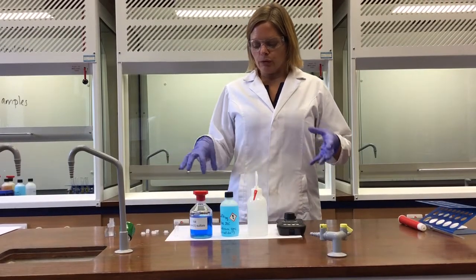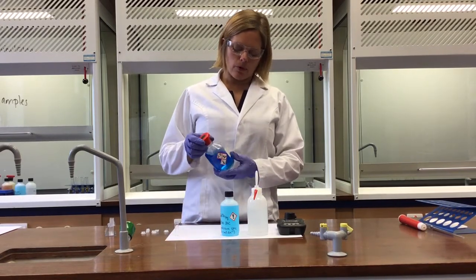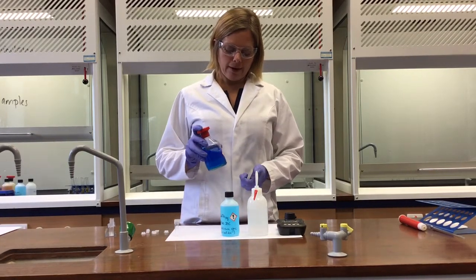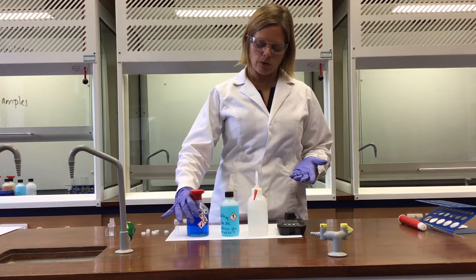We've been exploring the idea that transition metal ions have colour throughout the course, and this classic example, copper(II) sulfate with the [Cu(H2O)6]2+ ion, a blue solution, is here. Now, this is a known concentration of copper(II) sulfate, so this is 1 molar concentration, 1 mole per decimetre cubed concentration in this bottle.